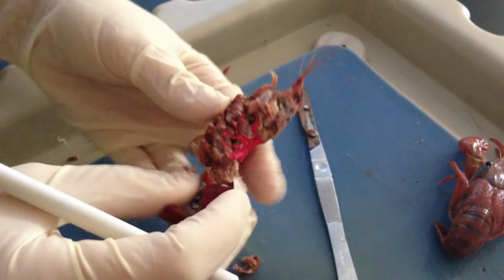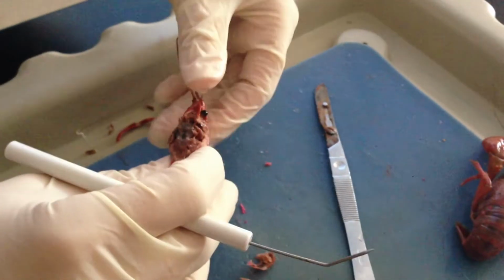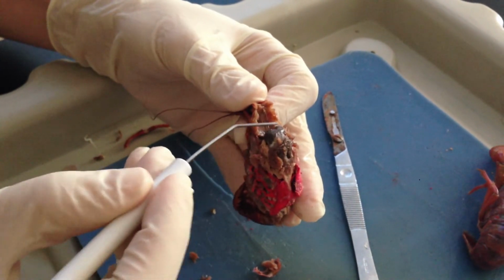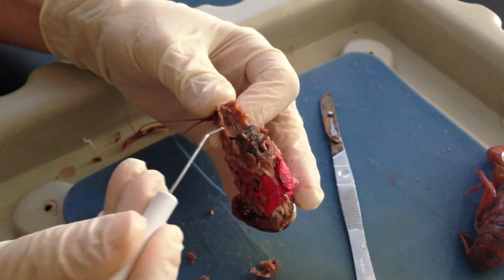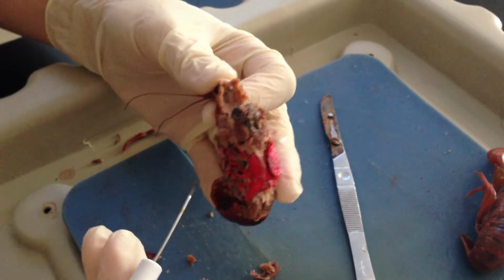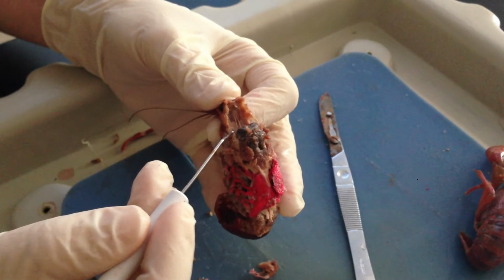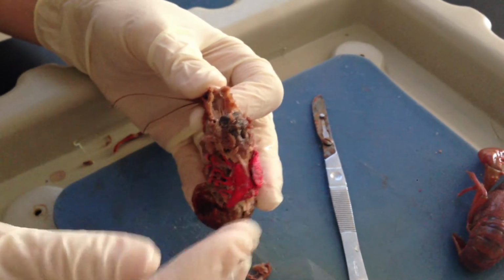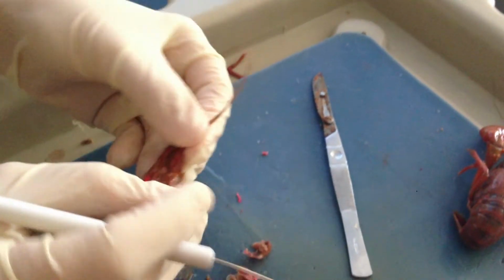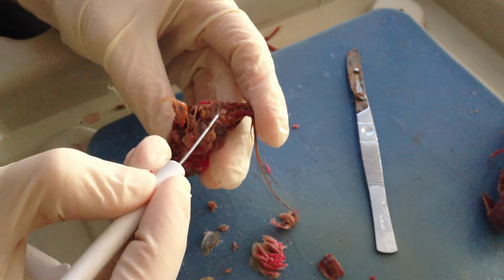Okay. Going back up to the most anterior end of this organism, I'm going to pull this down, and you can see that when I pulled it down, I've exposed more of the stomach, but down below in this region are these two different glands, and they're the green glands, and the green glands are used to regulate the amount of nitrogenous waste that's inside of this organism and regulates the salt. It actually releases out, if you flip it back over, into these two pores right here.